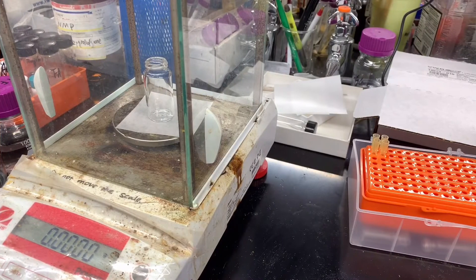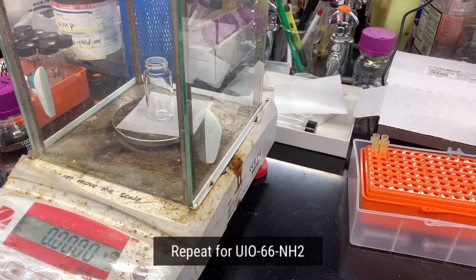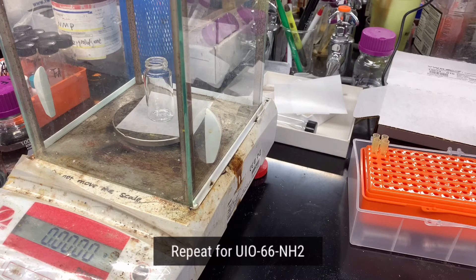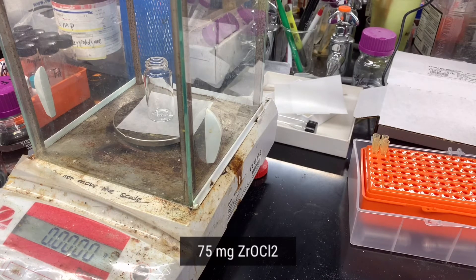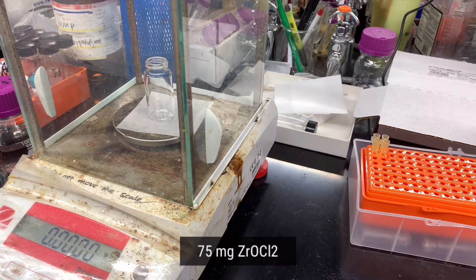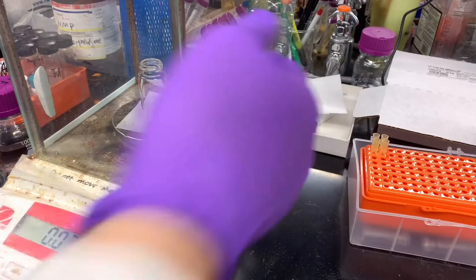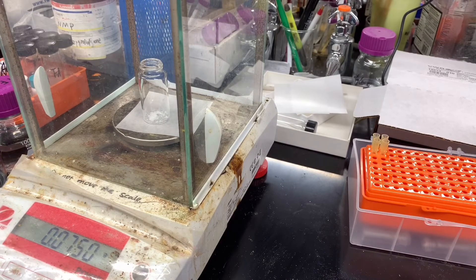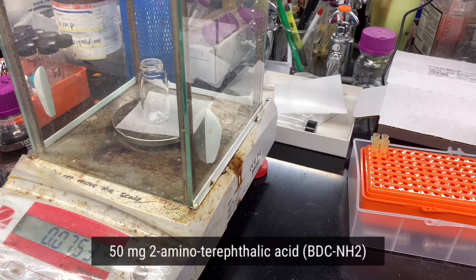We just repeat the procedure for the UiO-66 with amino function group. First, we need to add 75 mg of zirconium dichloride oxide. Then we need to add 50 mg of amino-BDC.